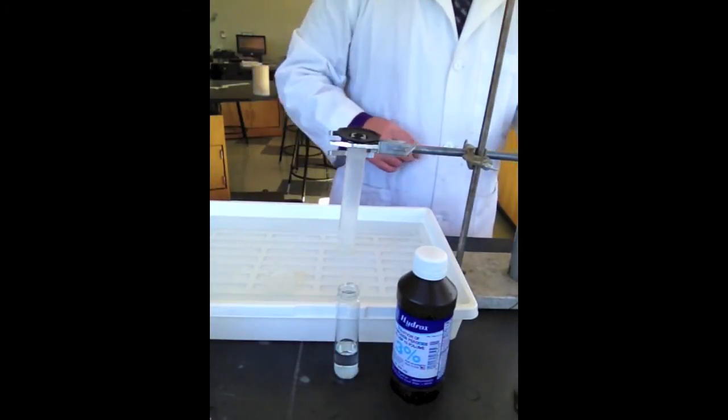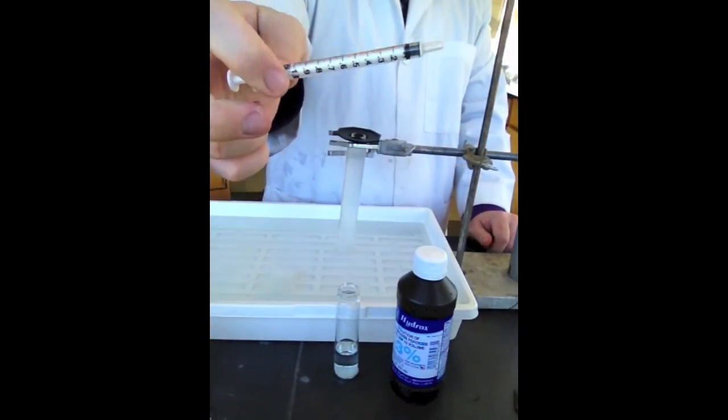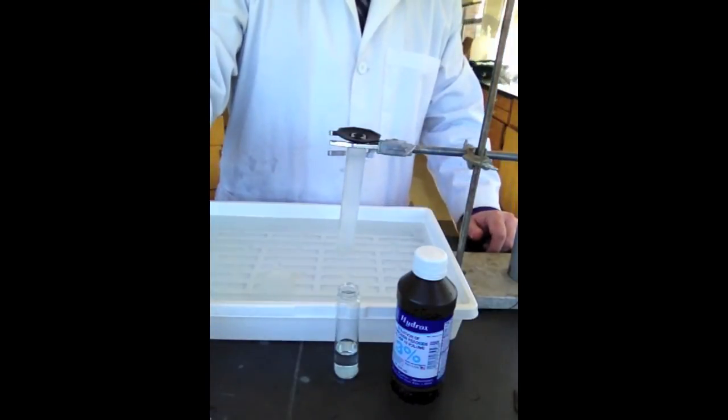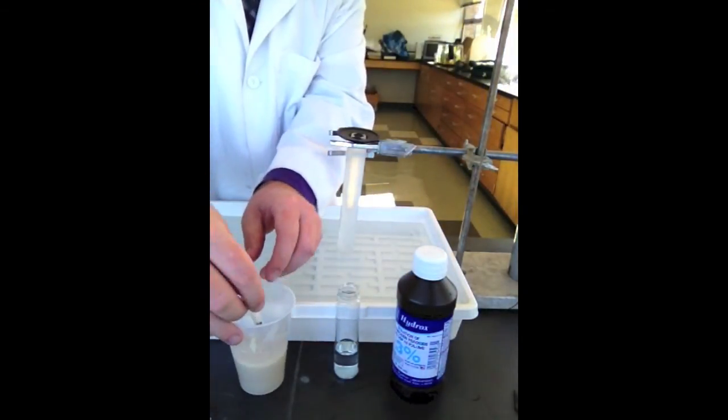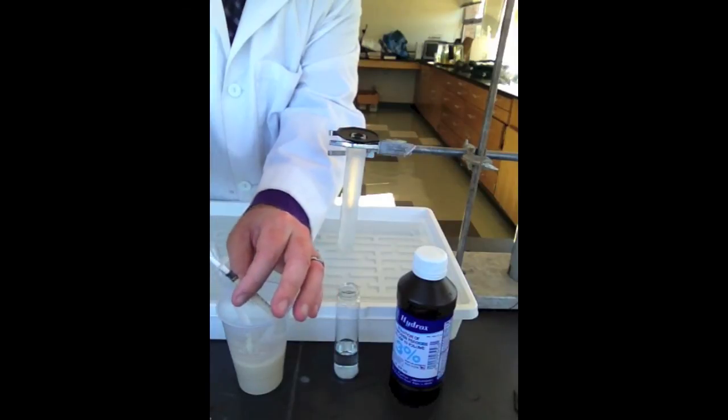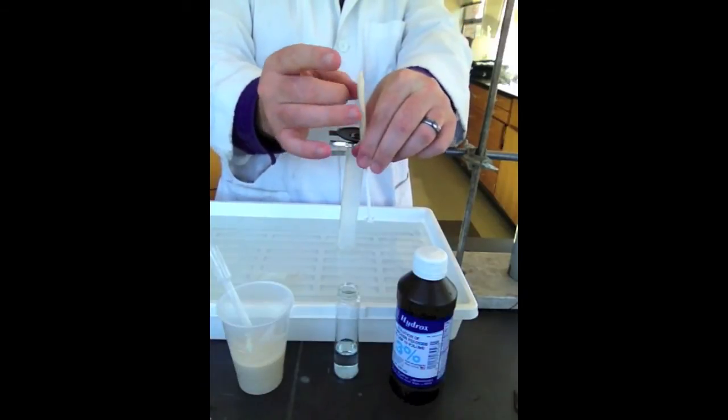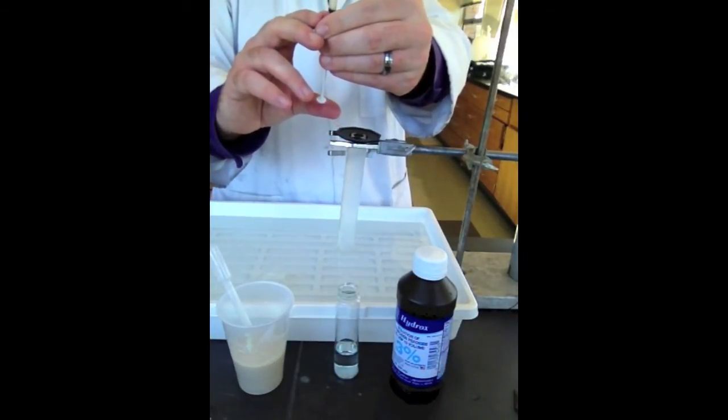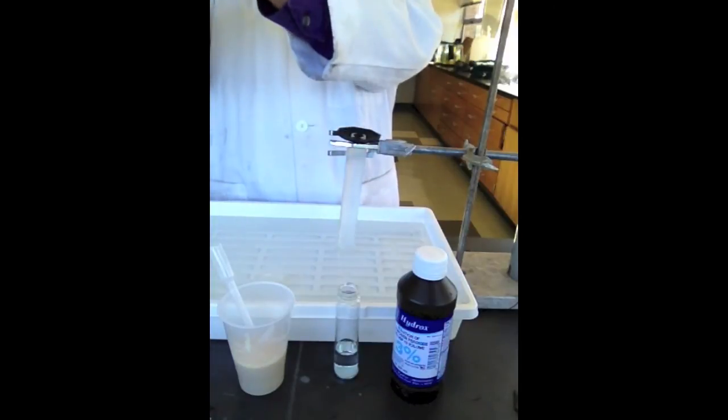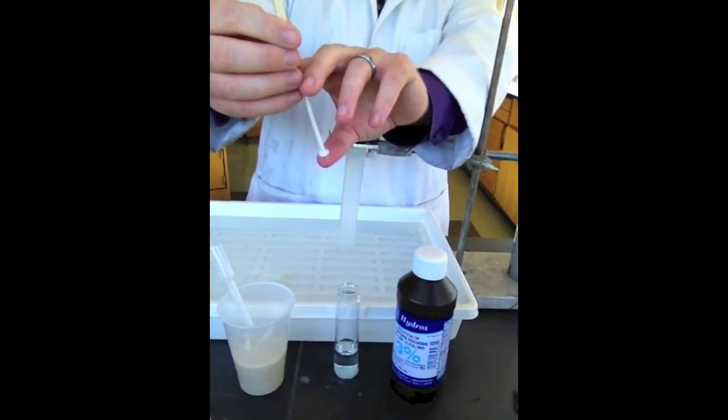Now, I'm going to have some syringes around here. Not syringes that have a needle on it, but just a reservoir part without the needle that you would see at a doctor's office. All right, so this is a 1 ml syringe. So, I'm going to draw up from our yeast stock 1 ml of yeast solution. All right, so we're going to get the air bubbles out. We're going to flick that and bring it up so it's exactly at 1. So, I need a little bit more in there. There we go. So, any extra, you could just flick it and expel it through the top.